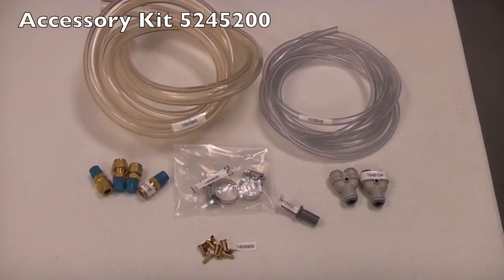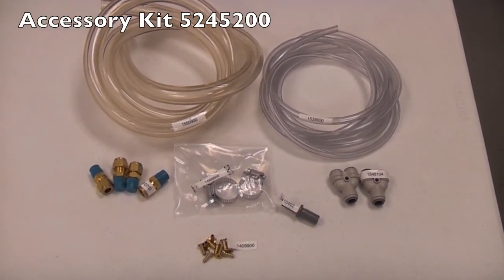The accessory kit shown includes the tubing and fittings you will need.